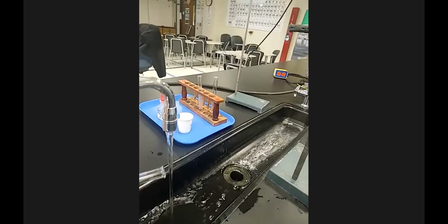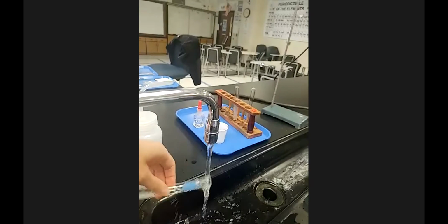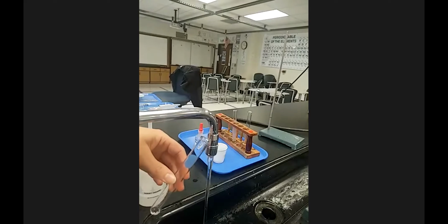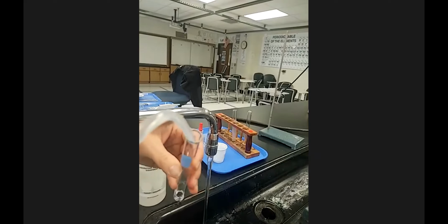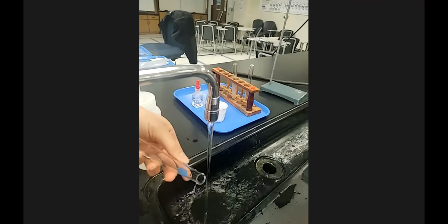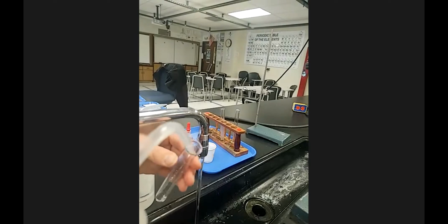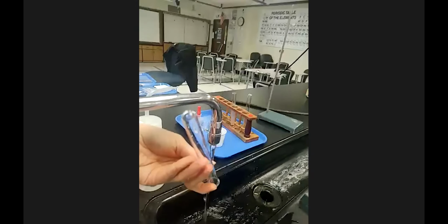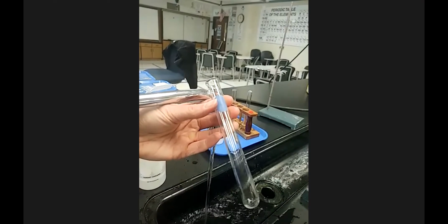And you might be like, Ms. Bird, why are you showing this part? But honestly, you guys learning lab technique and how to take care of glassware and putting it back how it is still a big part of chem. An AP question a couple years ago was asking why shouldn't you add water to a solid in a test tube? Well, it was literally getting at solubility of a solid, in that not everything is soluble in water. And so they do talk about little details like this.